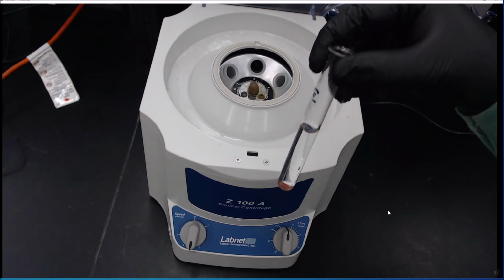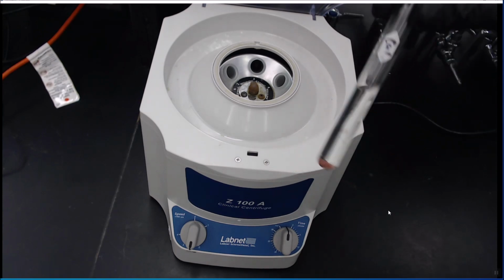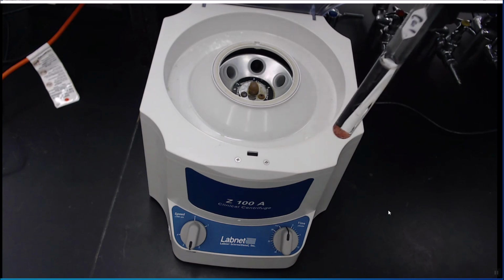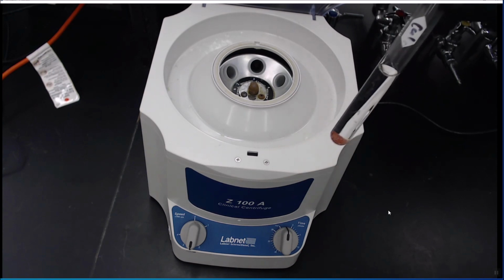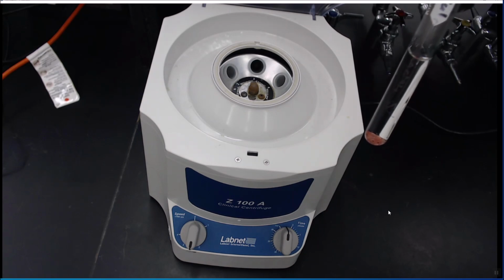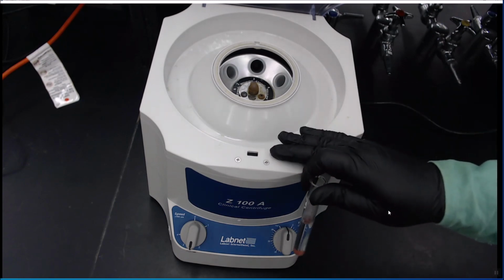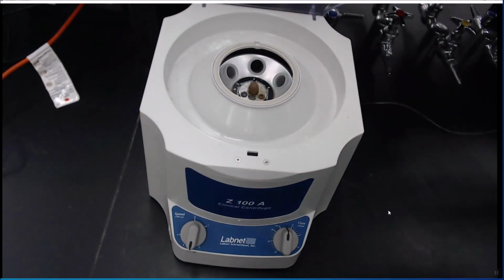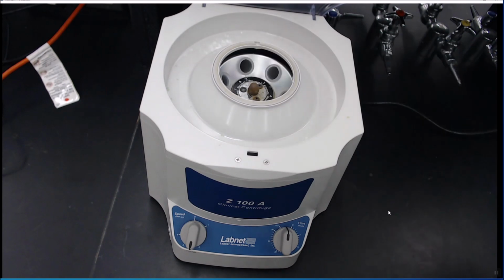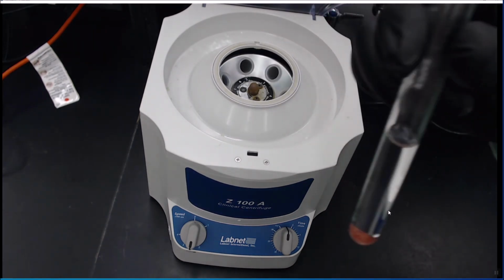So here you can see our finished reaction. But while we have our copper, we are not ready to get rid of all this liquid yet. If we do, we will probably end up pouring off most of our copper. It's just a loosely packed powder in the bottom. To compact it, we're going to put it in this centrifuge, which will spin the test tubes very rapidly and compress that copper into a nice pellet.